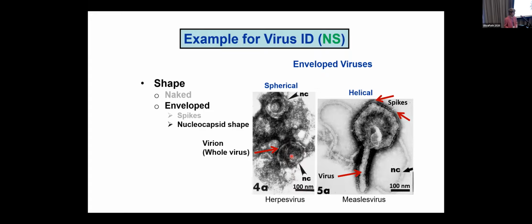This is herpes virus. So if I see a particle whose nucleocapsid is about 100 nanometers, it's probably in the herpes virus family. Now there are several herpes viruses in that family, so I couldn't look at it like this and tell you that it's herpes simplex or cytomegalovirus or EBV. But the nucleocapsid shape is important. The whole virus itself is called the virion.